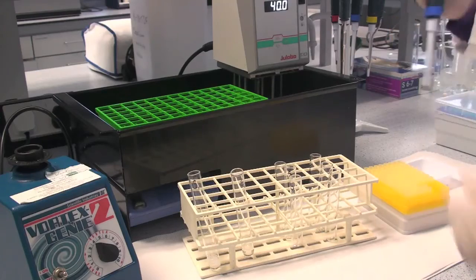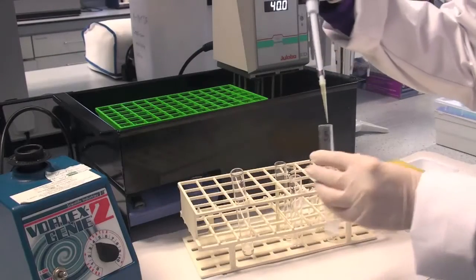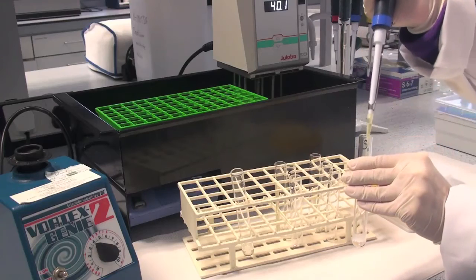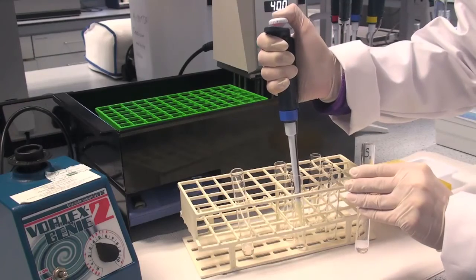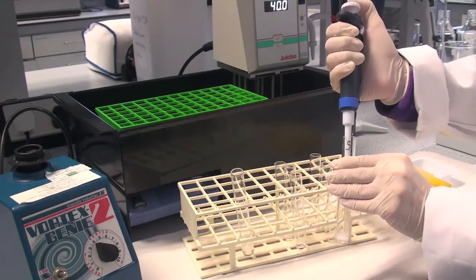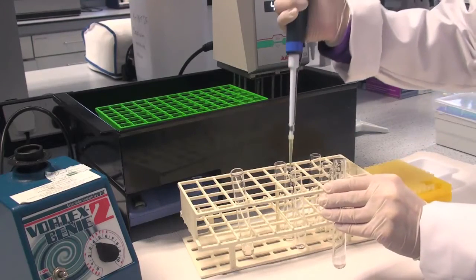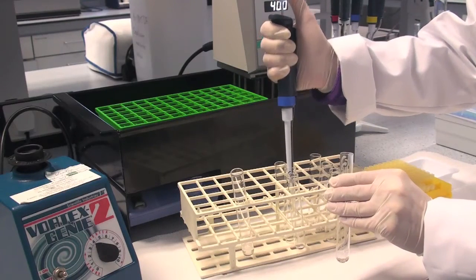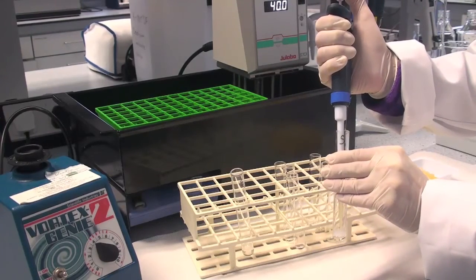Accurately and carefully transfer 0.2 ml aliquots of solution S for each sample into the bottom of three glass test tubes of dimensions 16 by 100 mm. The solution must be transferred to the bottom of the tube to ensure that it comes in complete contact with the next enzyme added, the fructanase solution.